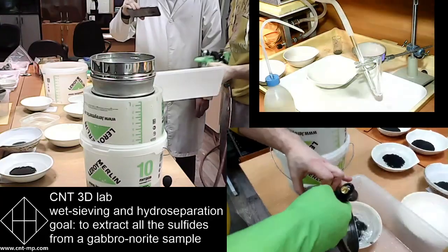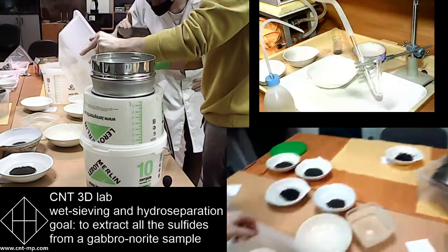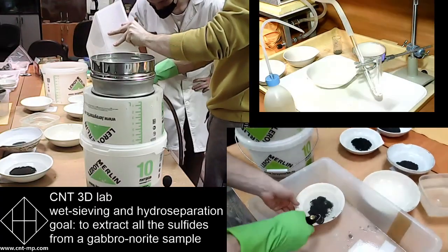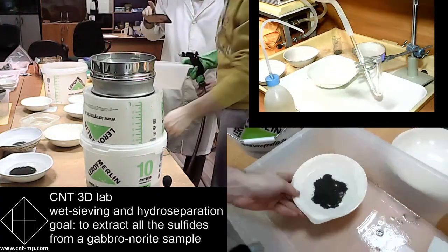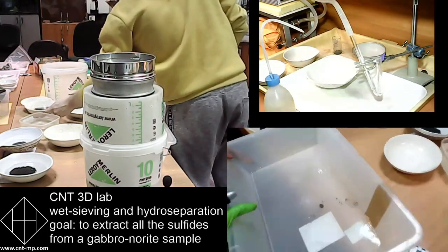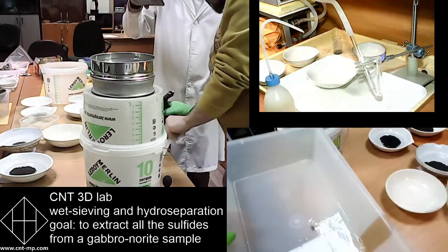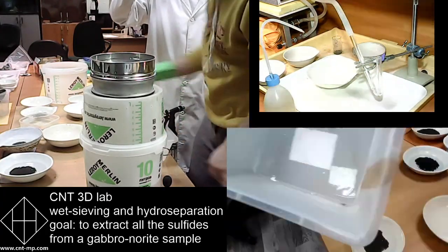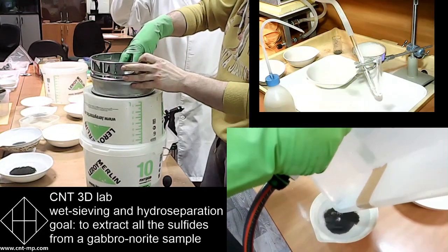If you can see the spills coming out of the sieve in the same tray, we can always reconcile that part that is lost in the tray into the same wide mouth dish. So these particles can go back to the same dish.